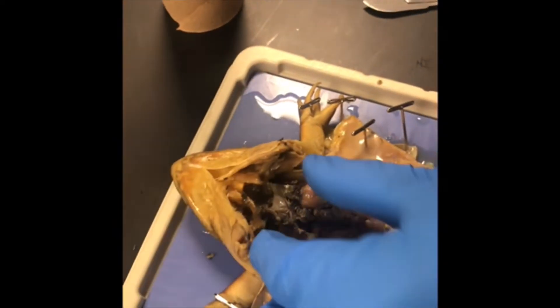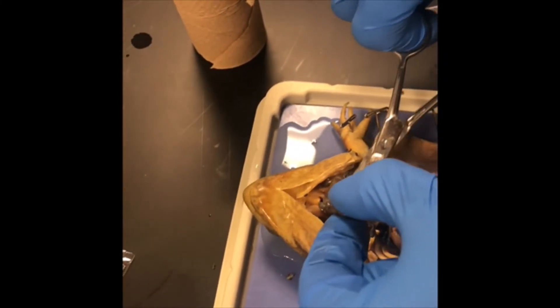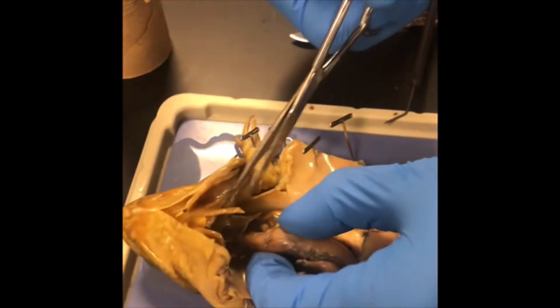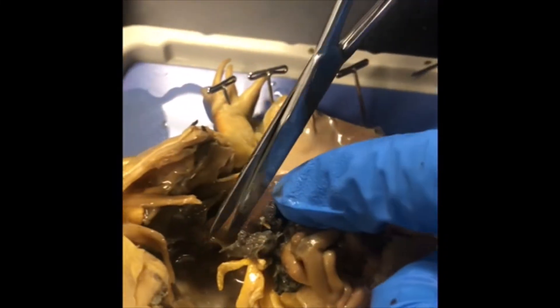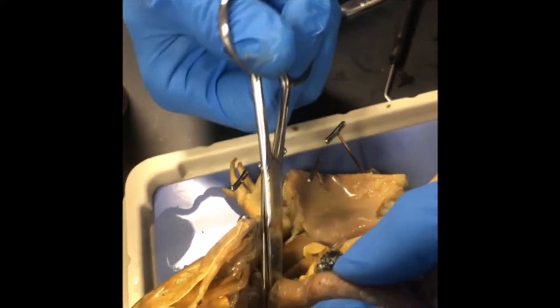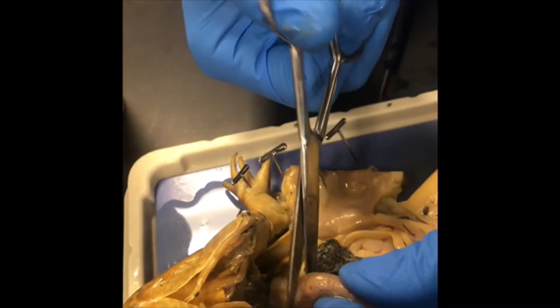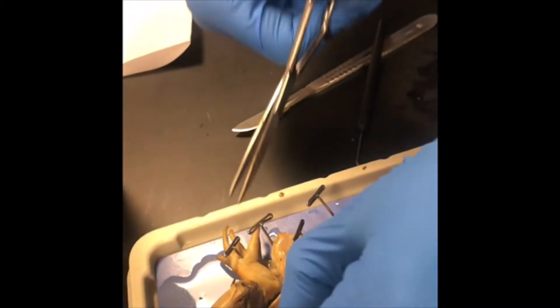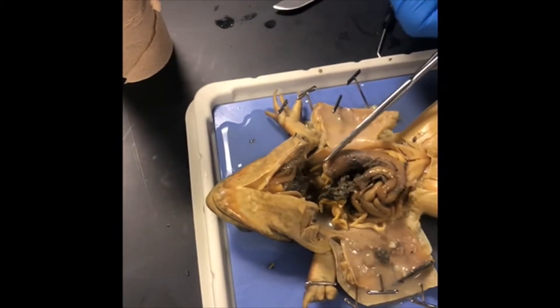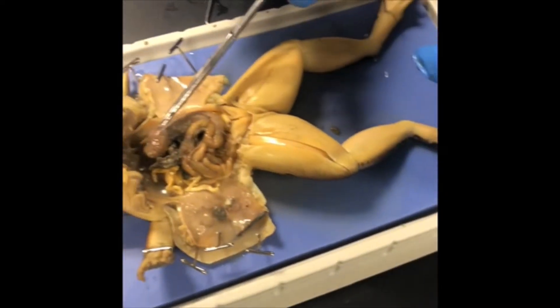The top of the liver is still in place, so I'm going to remove it to access more of the organs. Now we are locating the esophagus, which is right here — the top of the stomach. Here's the stomach coming up to the top of the esophagus. The stomach connects with the esophagus and the small intestines and is whitish and J-shaped.